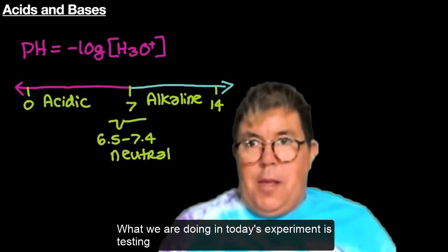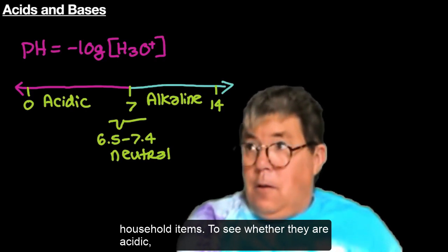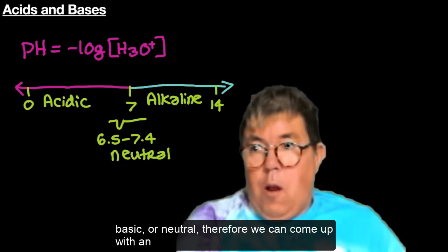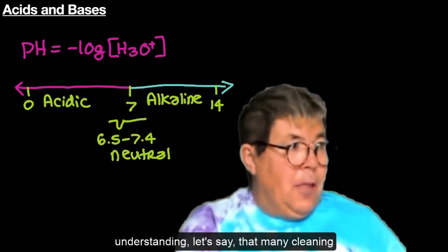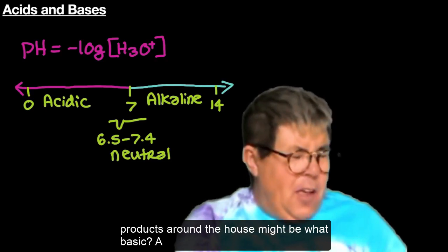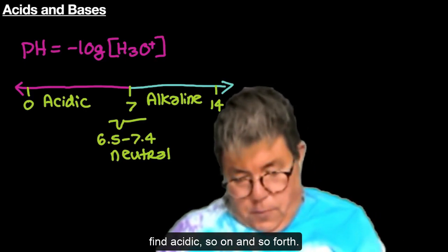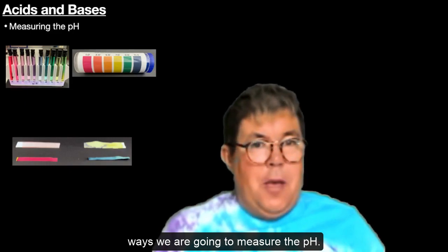What we are doing in today's experiment is testing household items to see whether they are acidic, basic, or neutral. We can come up with an understanding — many cleaning products around the house might be basic, while a lot of fruit juices we may find acidic. I want to show you how we're going to test for acidity. We are going to measure the pH in two ways.